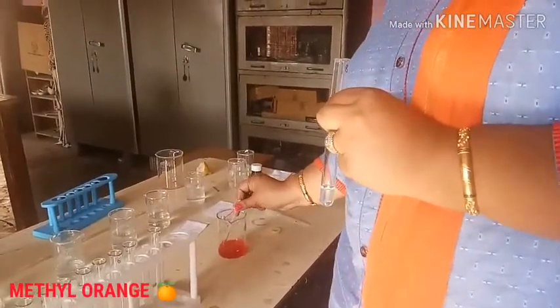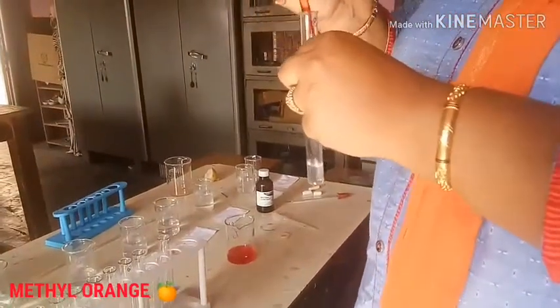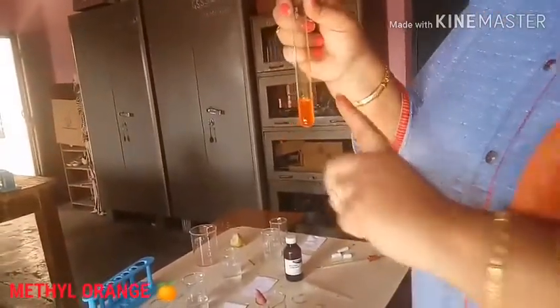I am going to ask you a question: base gives which color with Methyl Orange? The answer is yellow. Base gives yellow color with Methyl Orange — deep yellow — because it is an alkali containing a hydroxide group.